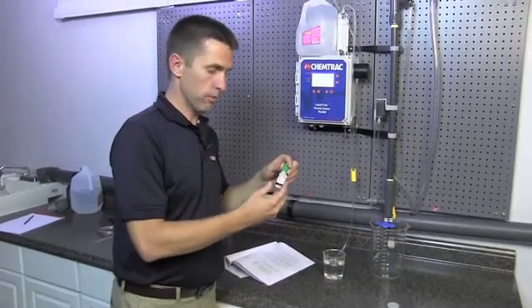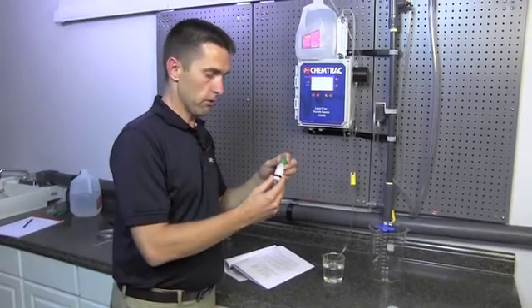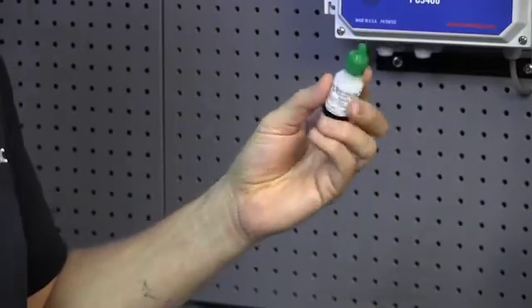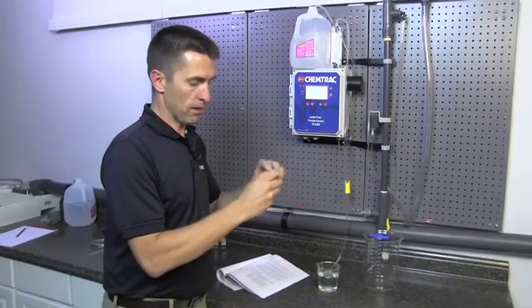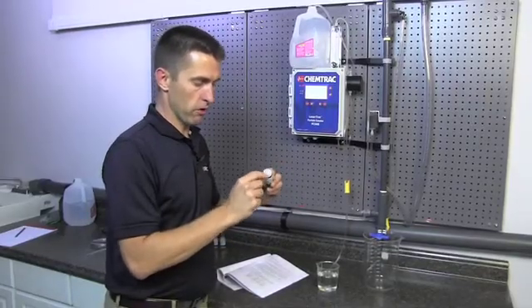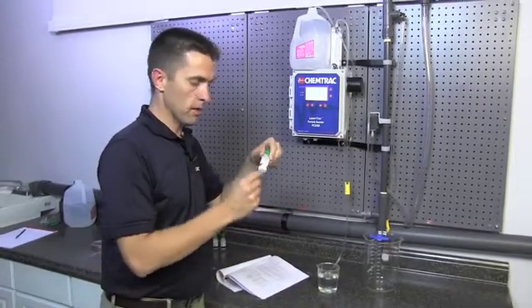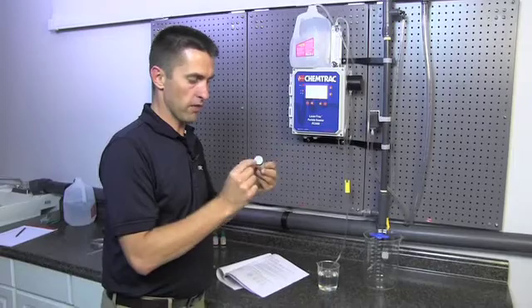You can take these and set them into an ultrasonic bath for 60 seconds to kind of make sure the spheres are fully dispersed and evenly dispersed into the bottle. Or you can just sit here and gently rotate the bottle of spheres for a few minutes. And what you're trying to really make sure of is that the spheres are off the bottom of the bottle. If it sits there on a table for a long period of time, all the spheres will kind of settle out and stick to the bottom.